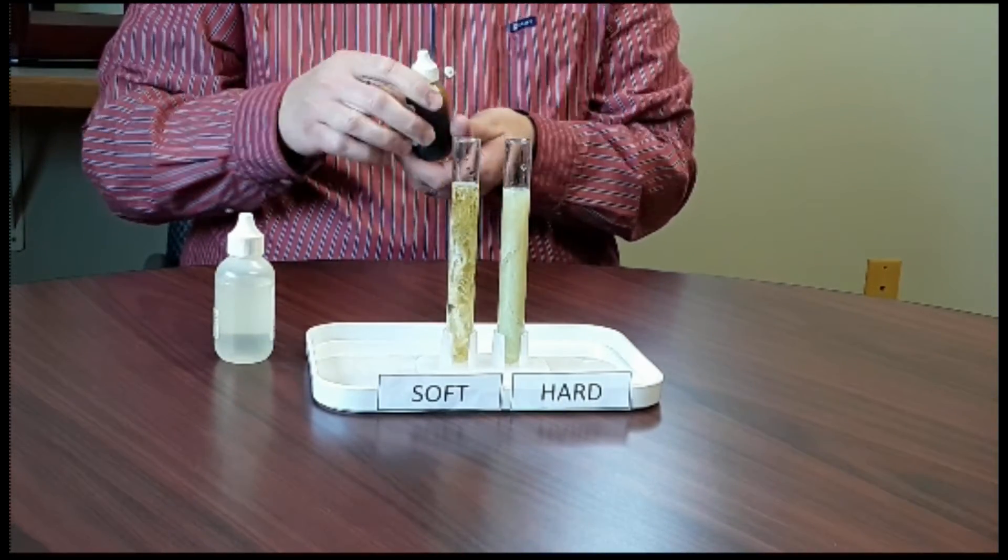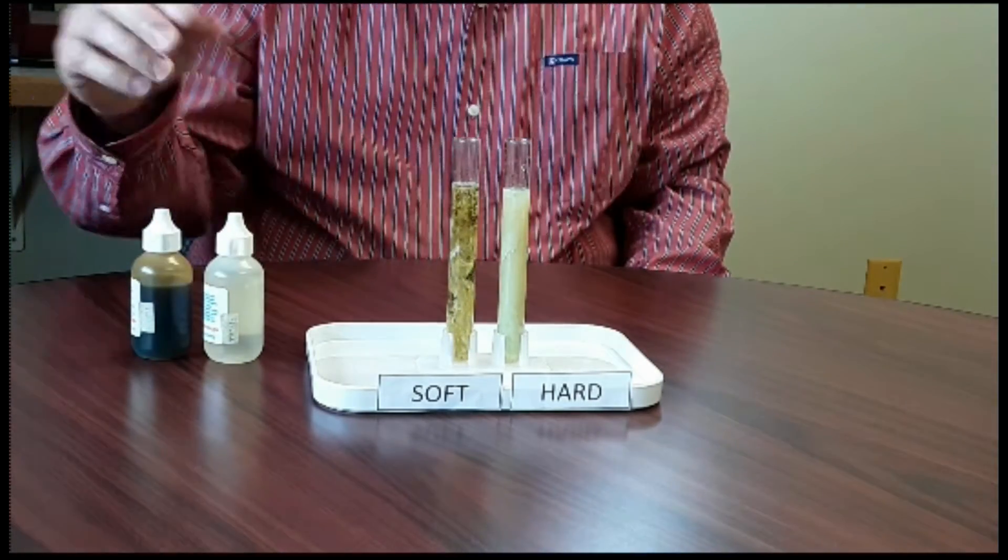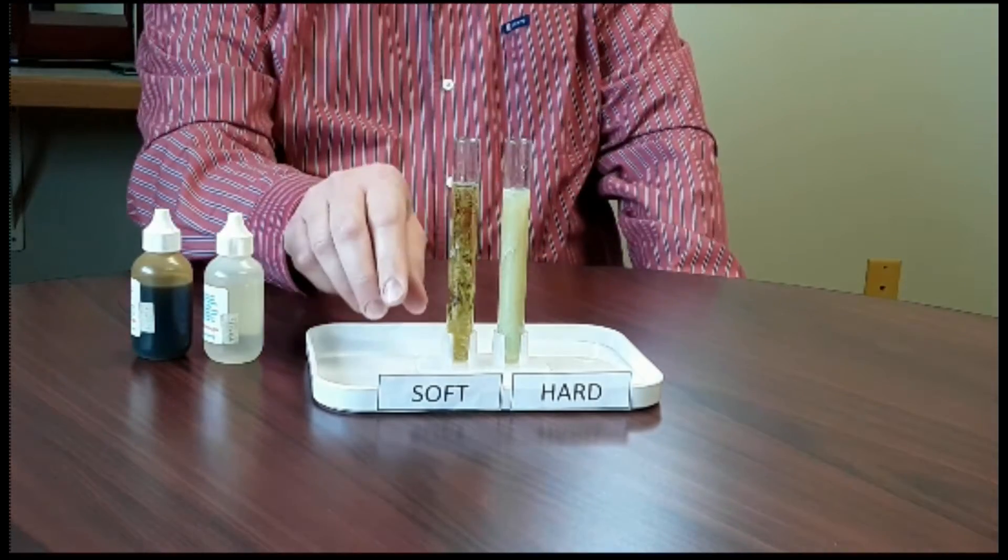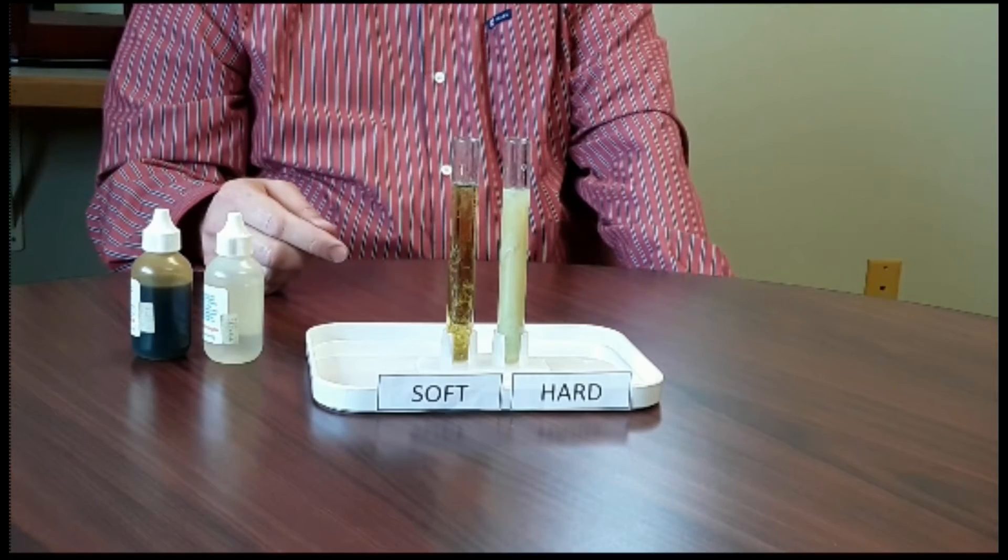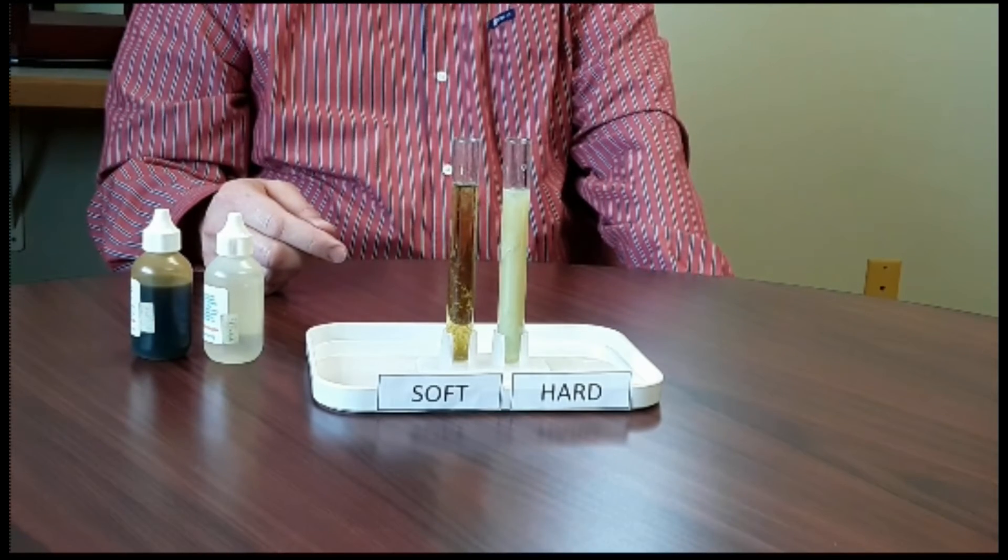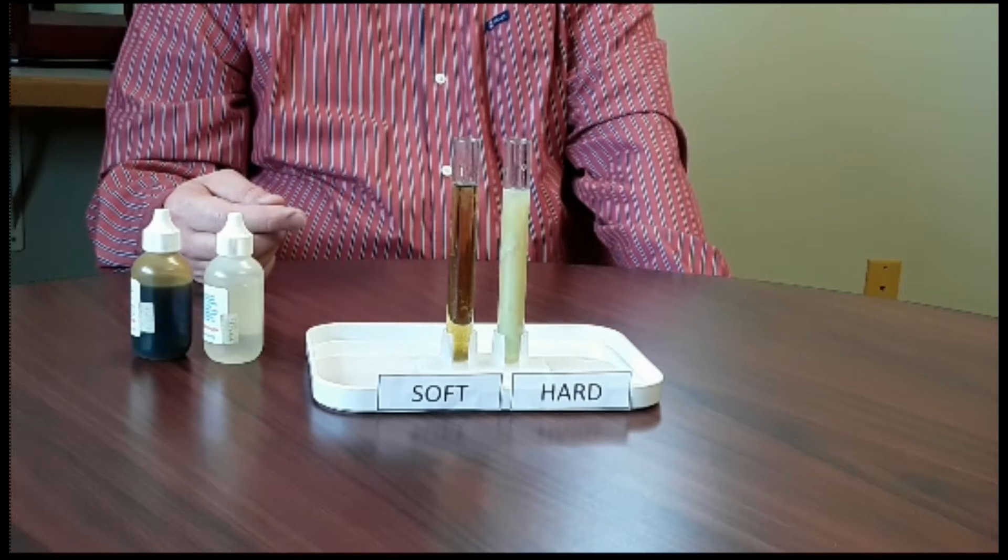As this settles, we're going to be able to see through the soft water vial and not through the hard water vial. Because again, we are bringing out the hardness in the water, which is your calcium, magnesium, as well as the dissolved solids.